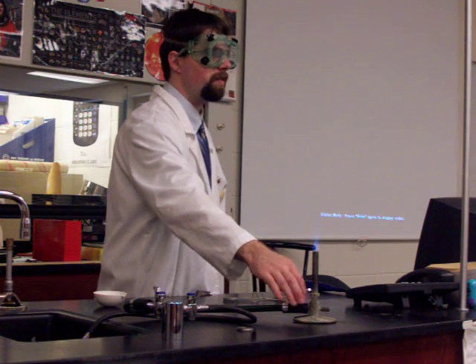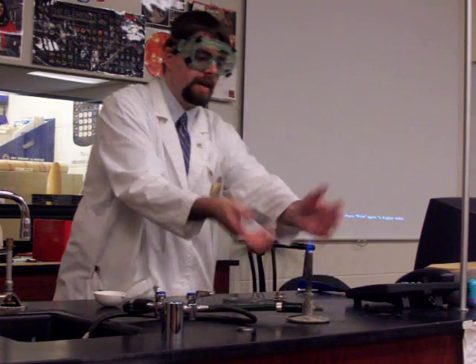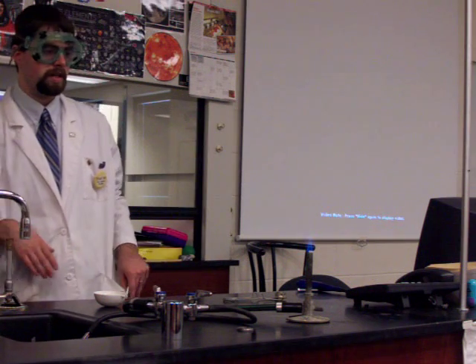There are two other types of adjustments. This one here has a screw. Others have a little sleeve that slides around these open ports. That adjusts how much oxygen is getting in there to mix with the flame. You'll notice the flame color changes when I do this. I can change the amount of oxygen that gets there. And if I get it real low, it's getting too little oxygen and the color of the flame is going to change.